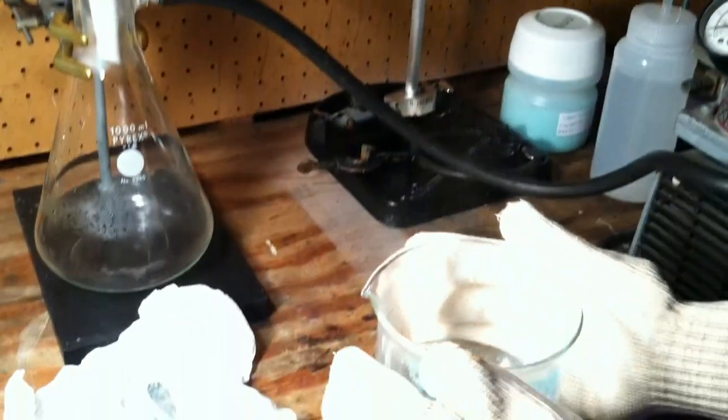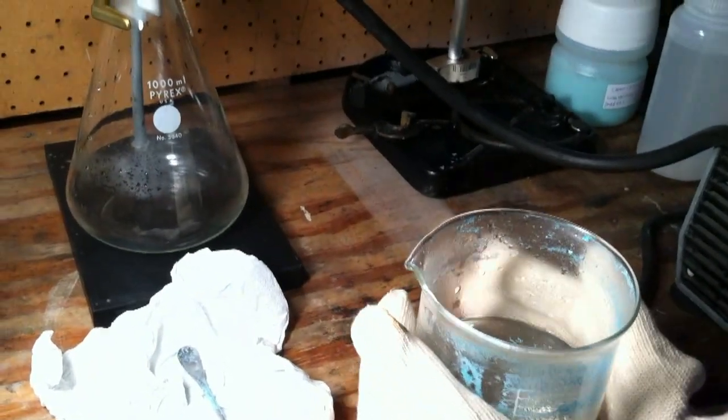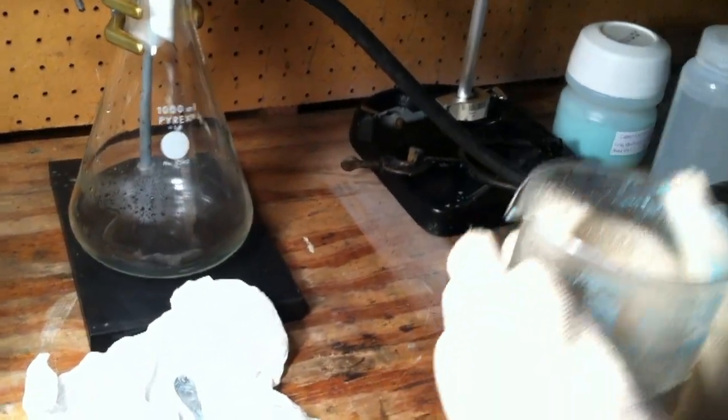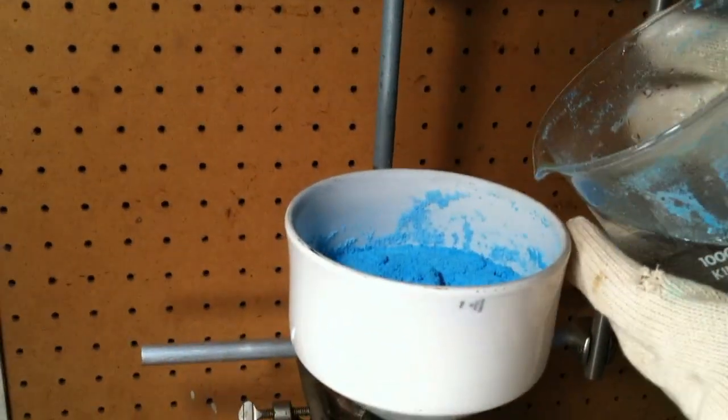Here is some hot water. We are going to add it to the copper benzoate just in case if there is any more acid.